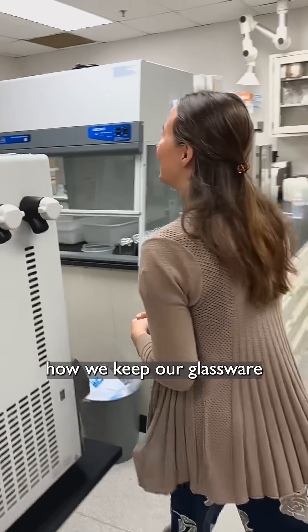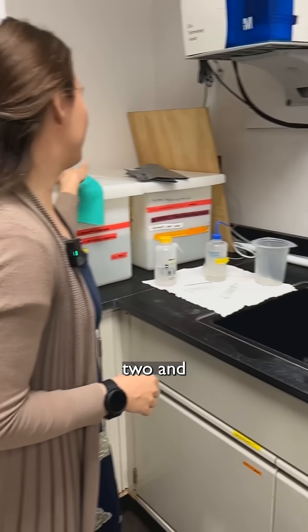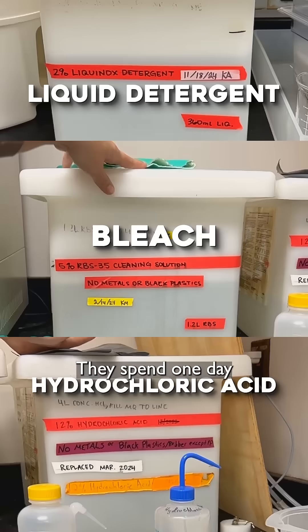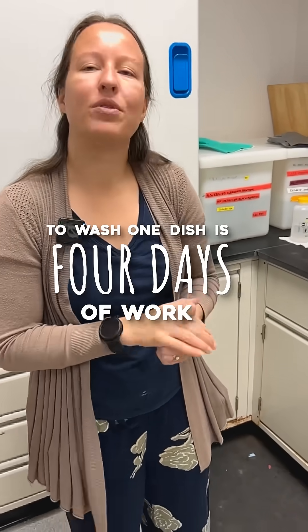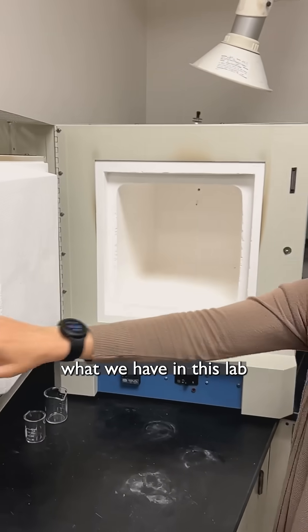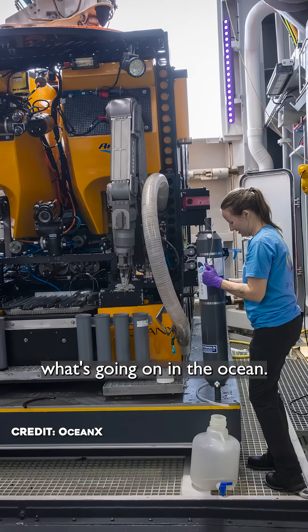I'll show you how we keep our glassware clean. All our dishes go through one, two, and three different baths — they spend one day in each bath, so it's a long process: washing one dish is four days of work. We need to get rid of all contamination in this lab to make sure we're measuring accurately what's going on in the ocean.